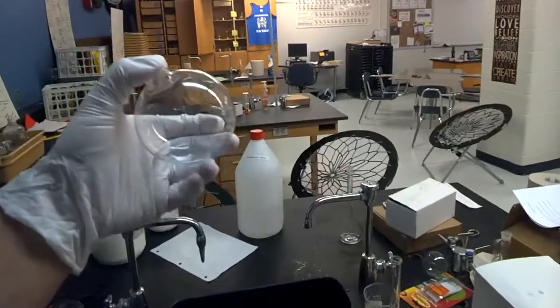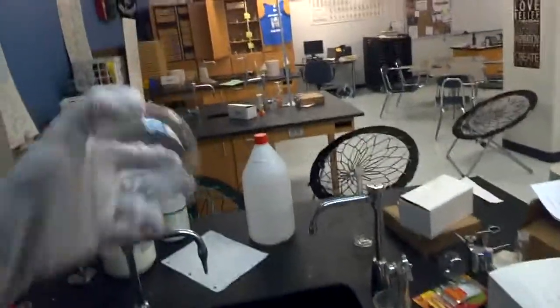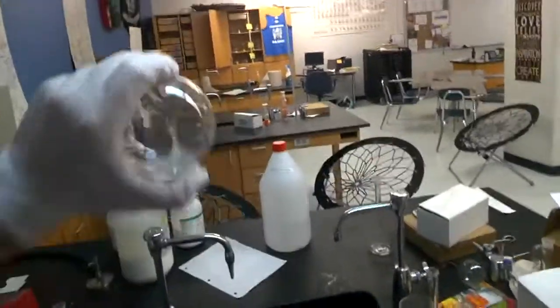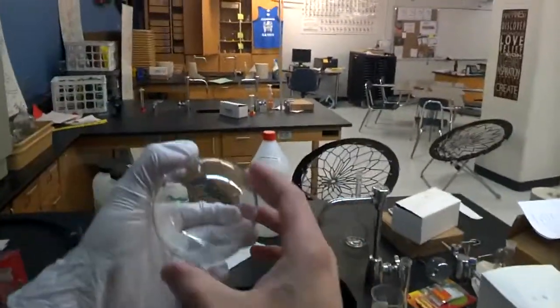So again I'm going to cap it and I'm going to give it a quick rinse. And what you're doing here is you're making sure that the solution touches all parts of the glass before you add the key ingredient which is the sodium hydroxide.